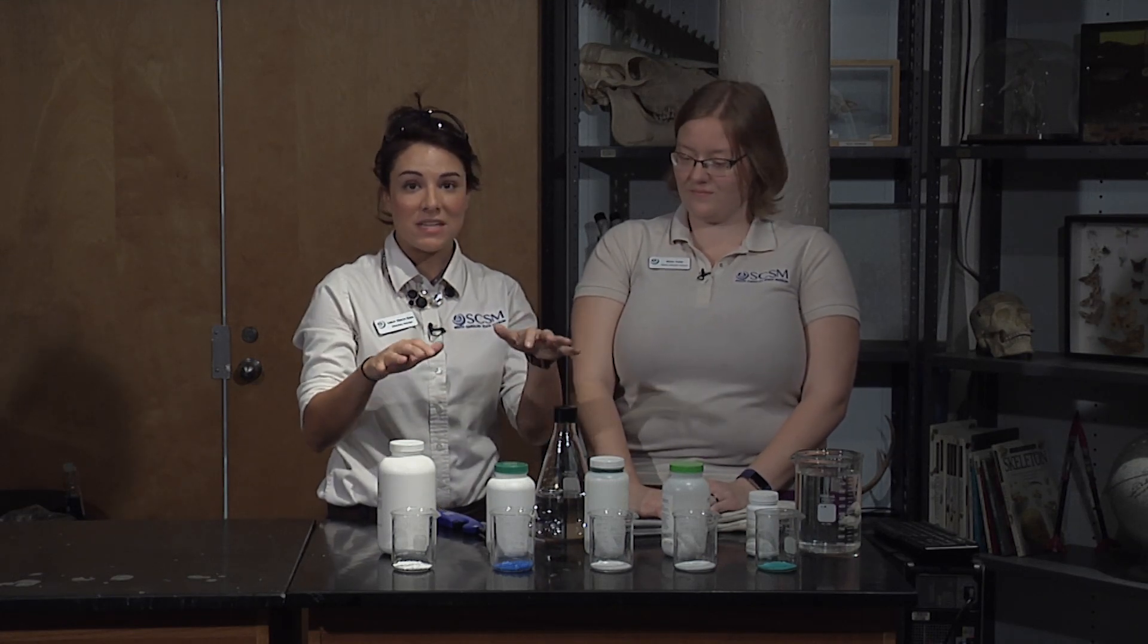We're here doing some pretty cool stuff with you today including chemical reactions and these are really cool salt fires where Miss Diana is going to show us some really cool things that happen with ionic and covalent bonds and energy transfer.